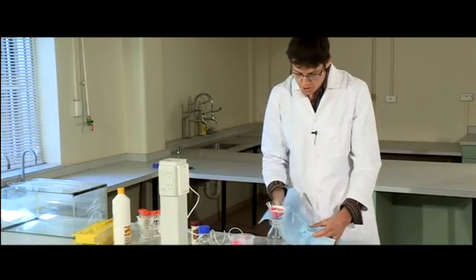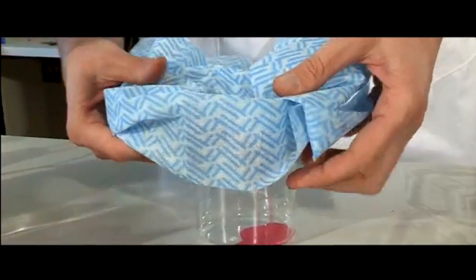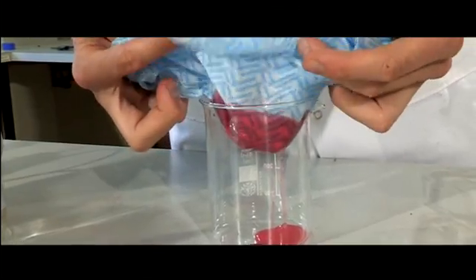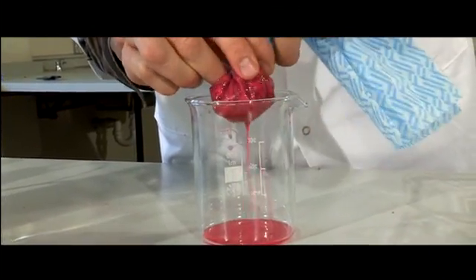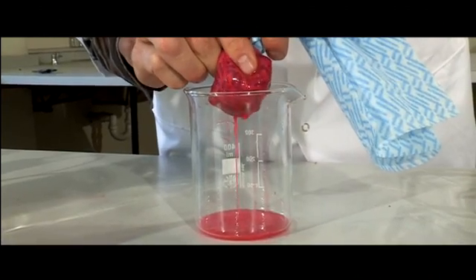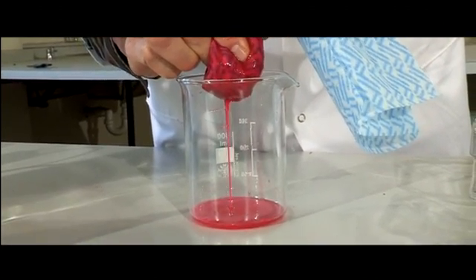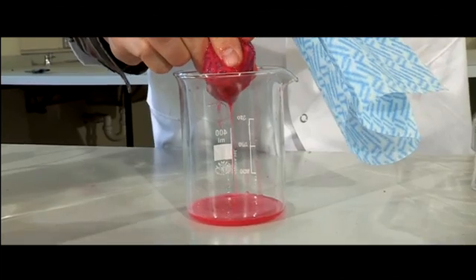Just strain it through the cloth. Very carefully pick this up slowly—you have to do it slow because otherwise it will squirt everywhere—but gently drain it through your cloth. You don't get as pure a sample, but it does the job, certainly if you're pushed for time.